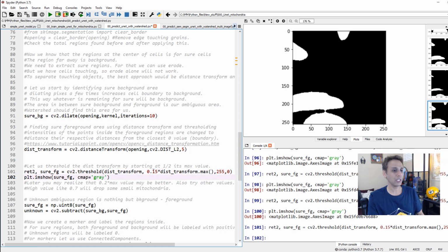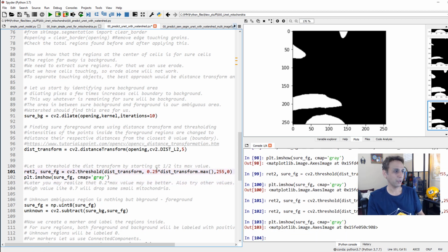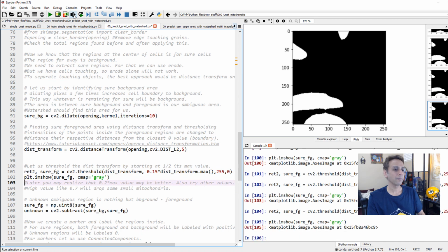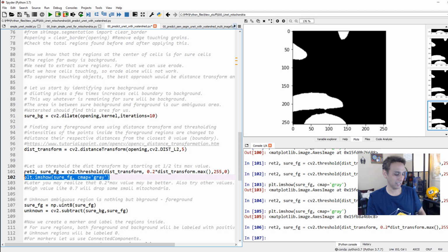So I usually test this on a few images, and then I make a decision. So 0.25 is probably okay, right there, or 0.2 is probably okay. I don't think I plotted with 0.15. Let's do that. 0.15 is also okay. Yeah, so for now, let's go ahead and leave it to 0.2. I think now you know exactly what's going on.